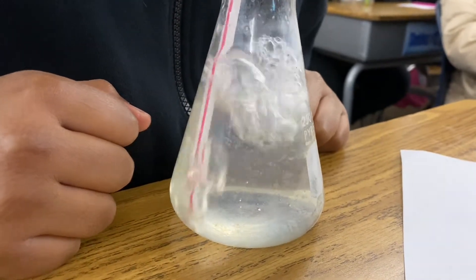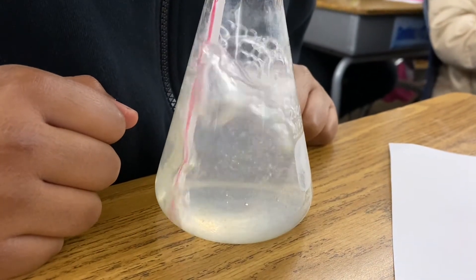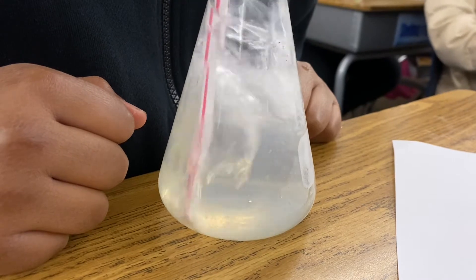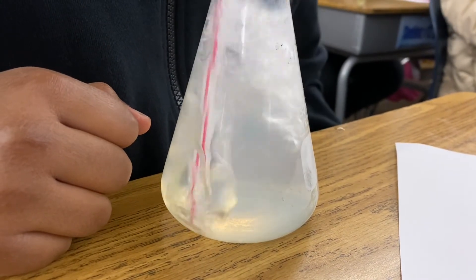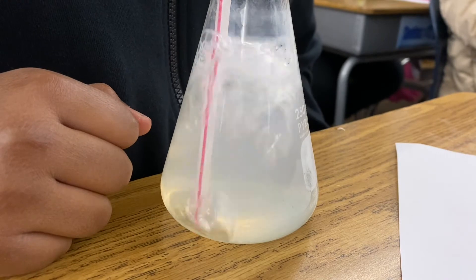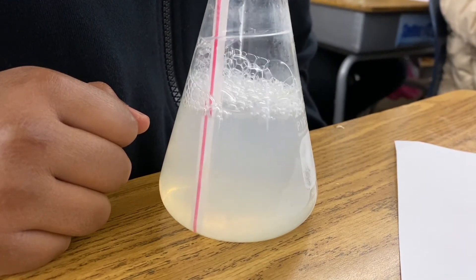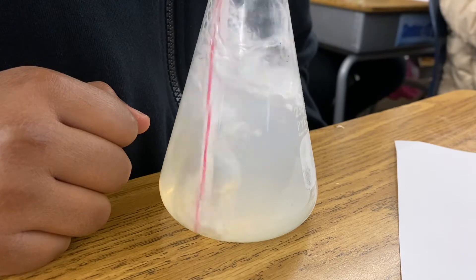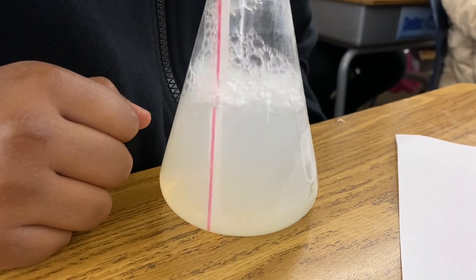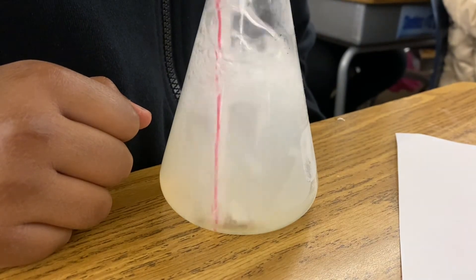This will actually create the precipitate of calcium carbonate, which we use to make sheetrock and chalk, and it's already turning really cloudy. Wow, you can't even see through it now.